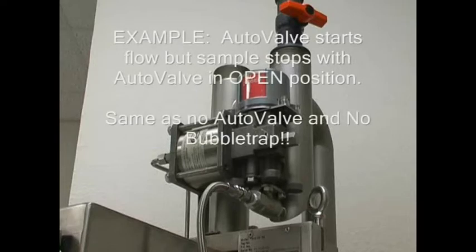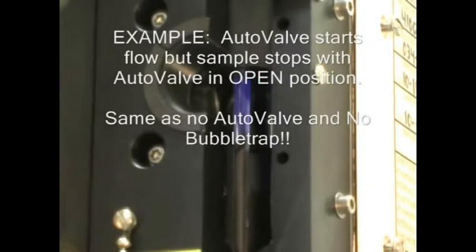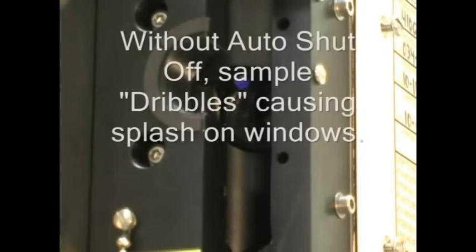In the first example, we start the flow using the auto valve, but end it with the auto valve in the open position. This allows the water to completely drain out of the bubble trap, simulating either a bubble trap with no auto valve or a flow cell with no bubble trap at all.